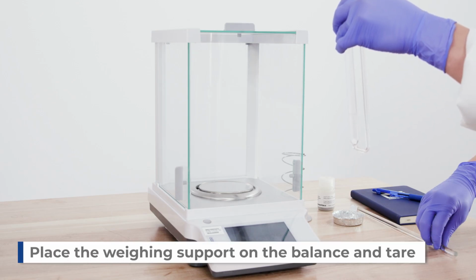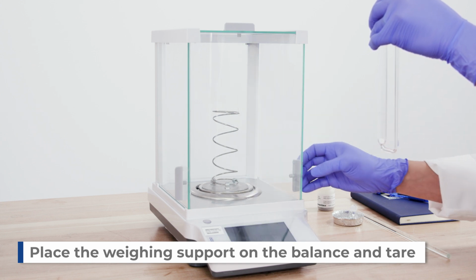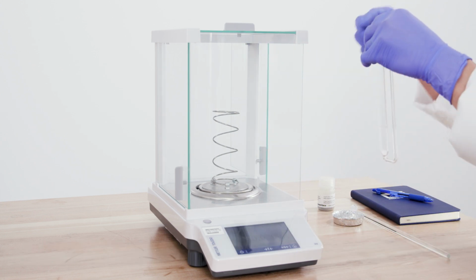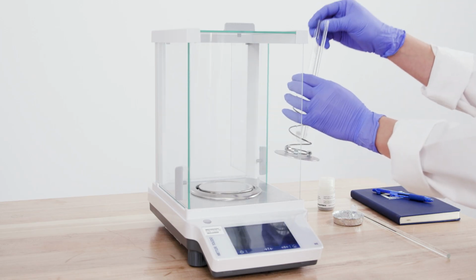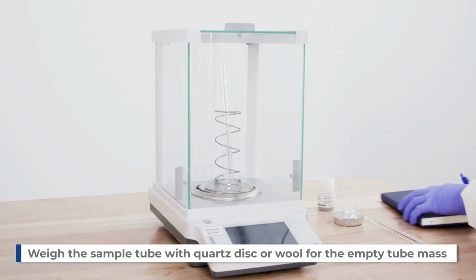Place the sample tube weighing support on the balance and tare. Record the mass as the empty sample tube.